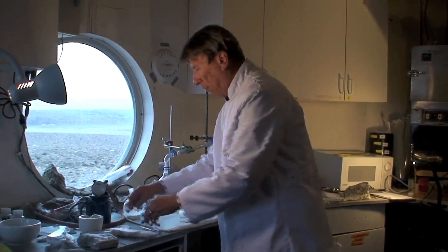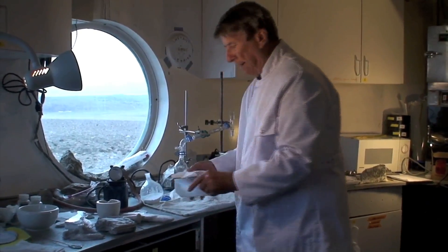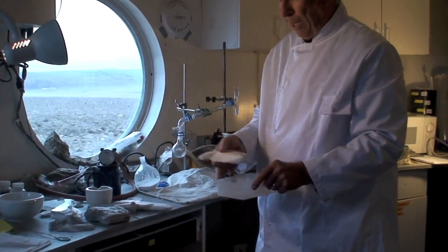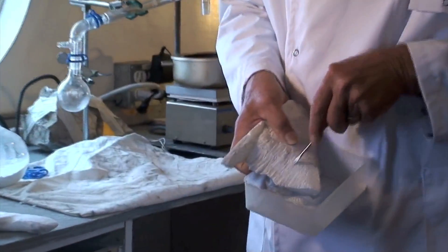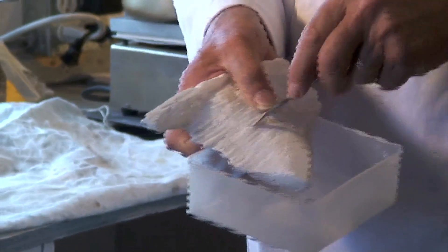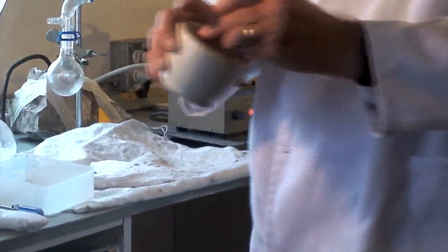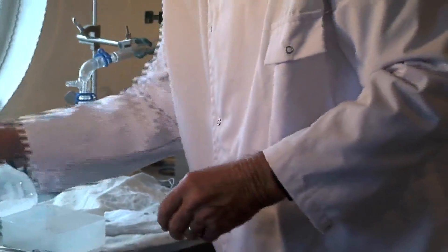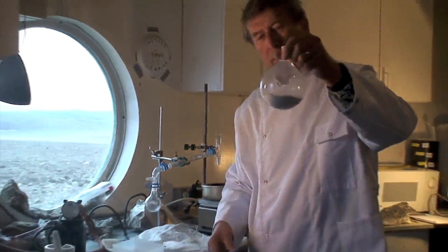As an experiment here on F.Mars, to save time instead of heating a big piece of rock, I decided to make some dust. You can actually scratch gypsum with your fingernail. So what we did is grind it up in a mortar and pestle, and now we have basically 100 grams of gypsum right here.